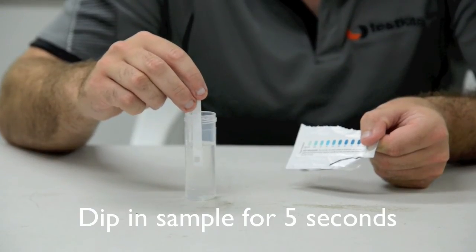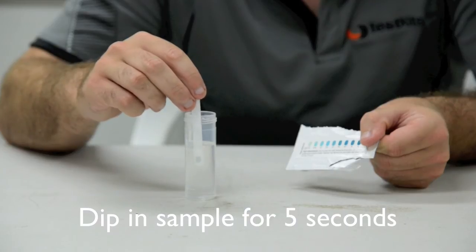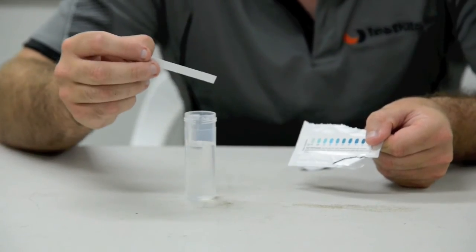Place the strip in the water and move back and forth for 5 seconds. After 5 seconds, remove from the water and wait 30 seconds.